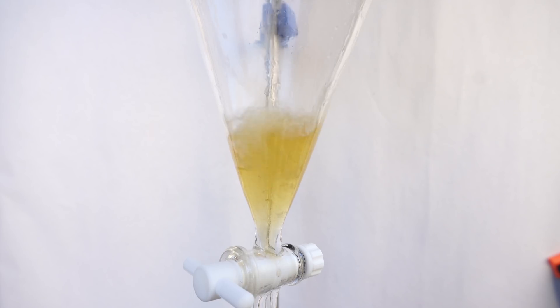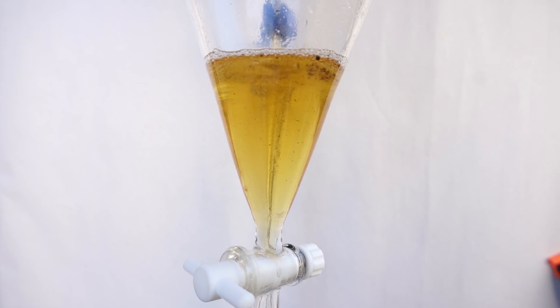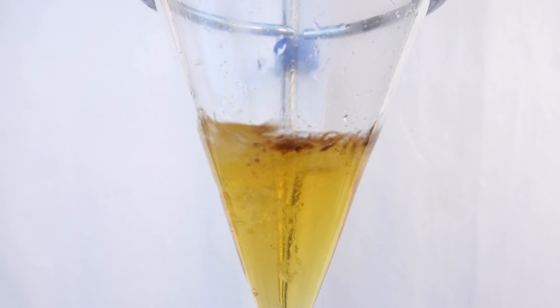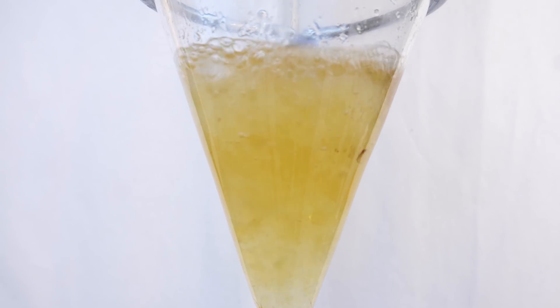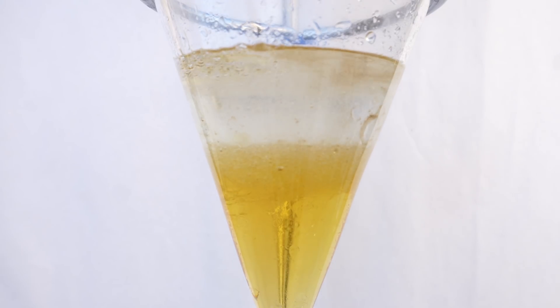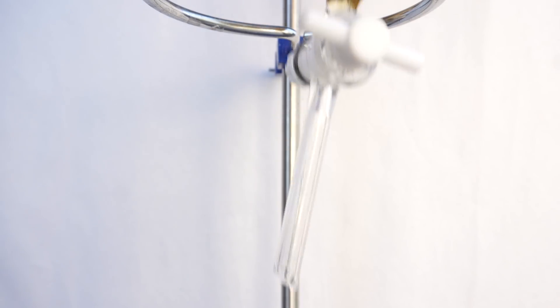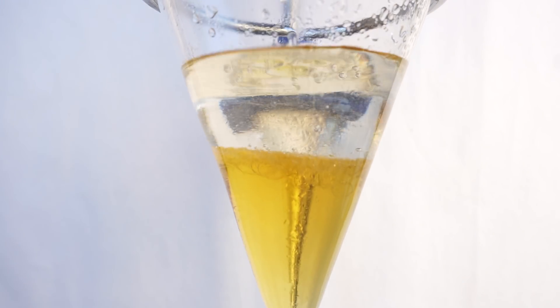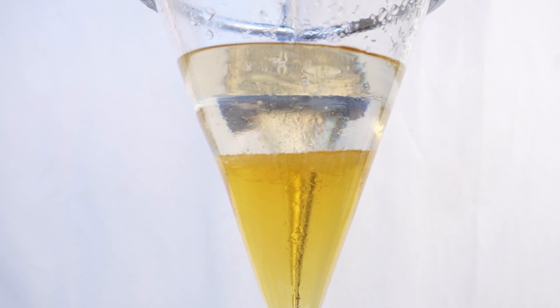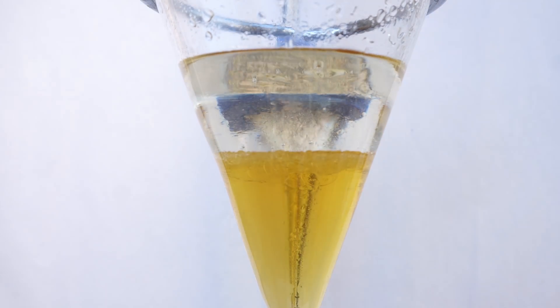Finally, after all 6 of my washings, I add the DCM into a clean separatory funnel, followed by 120 milliliters of saturated salt solution. Just like before, I cap, shake, and vent. This acts to dry the DCM from any water that still remains in it. It also cleans up a lot of the oils that contaminated my DCM from my emulsion. You can really see just how much cleaner the DCM layer is now. Before, it was dark and murky, and now it's just a nice yellow color.